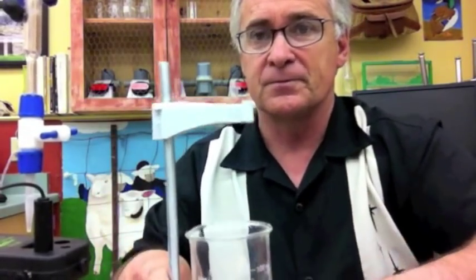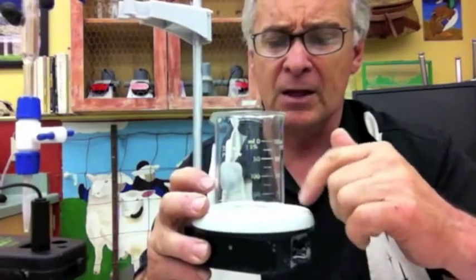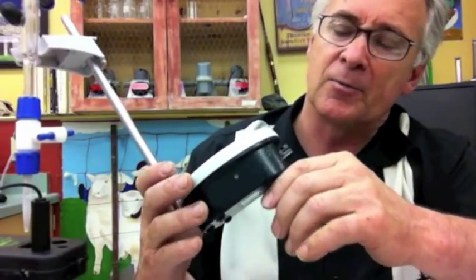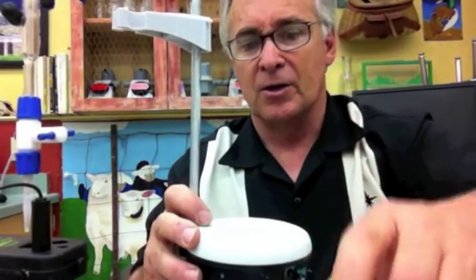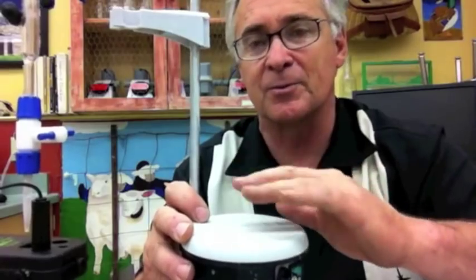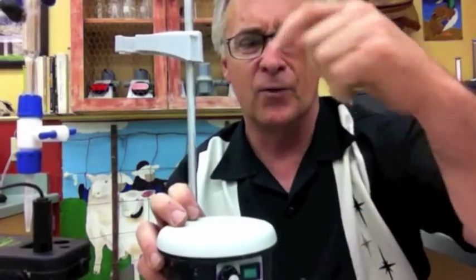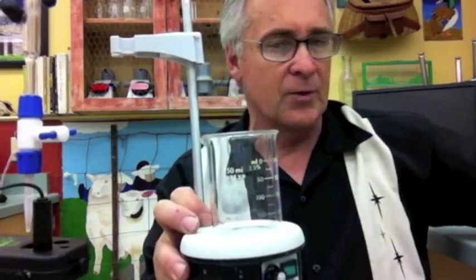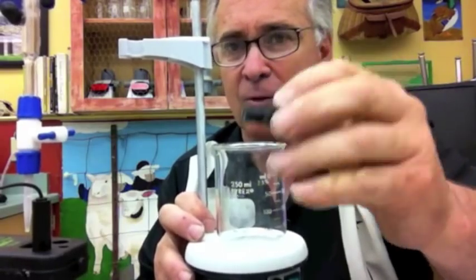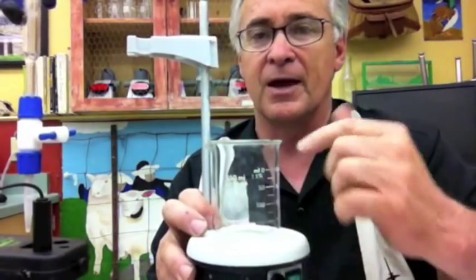You're going to put the solution in the beaker. Now, this thing right here is a stir plate — it allows us to spin a magnet. It's not a hot plate, it's a spin plate — there's a huge difference. You turn it on and off and determine the amount of spin; you don't want a heavy vortex. You can also use mini spinners or stirrers that go on the end of the pH probe. If you don't have one of those, just put a magnet in the bottom of the beaker and spin it.